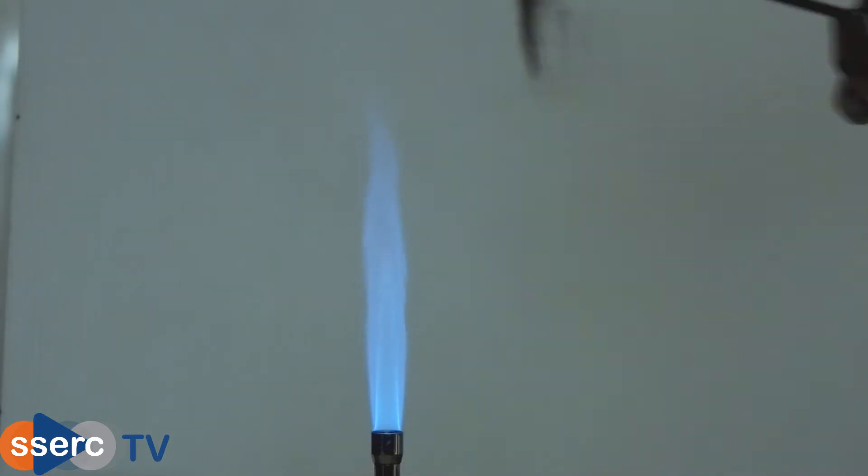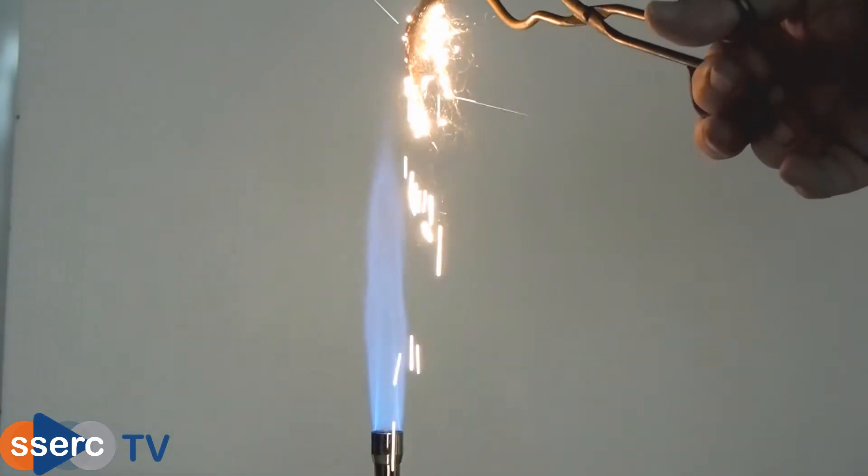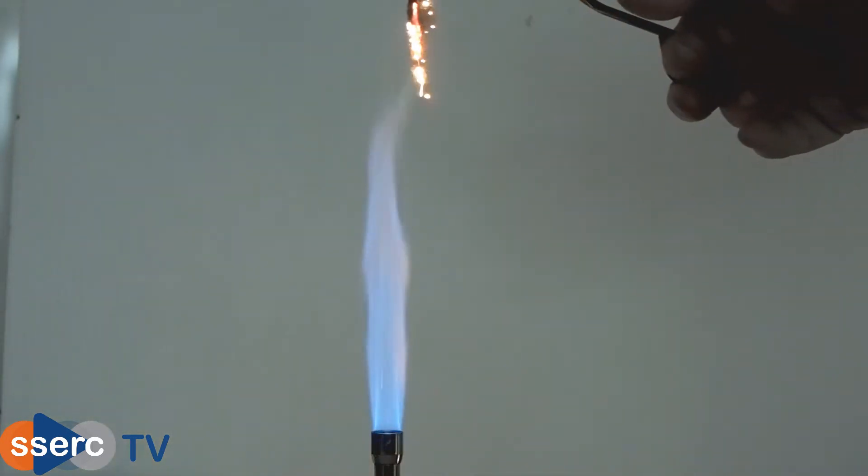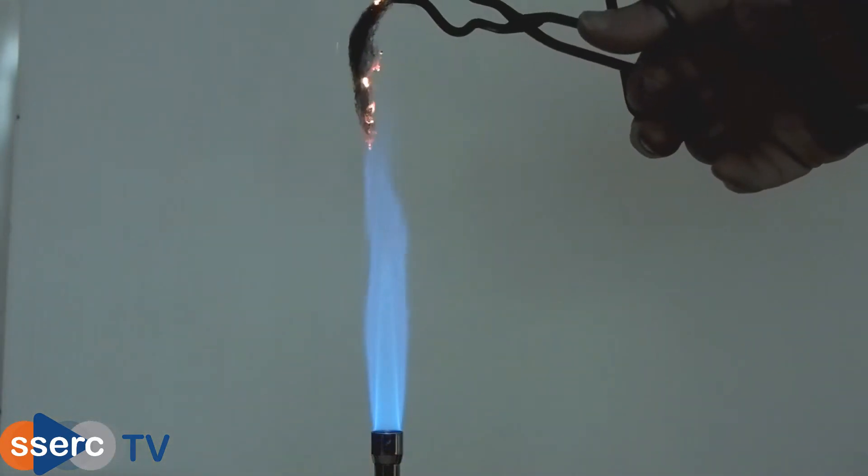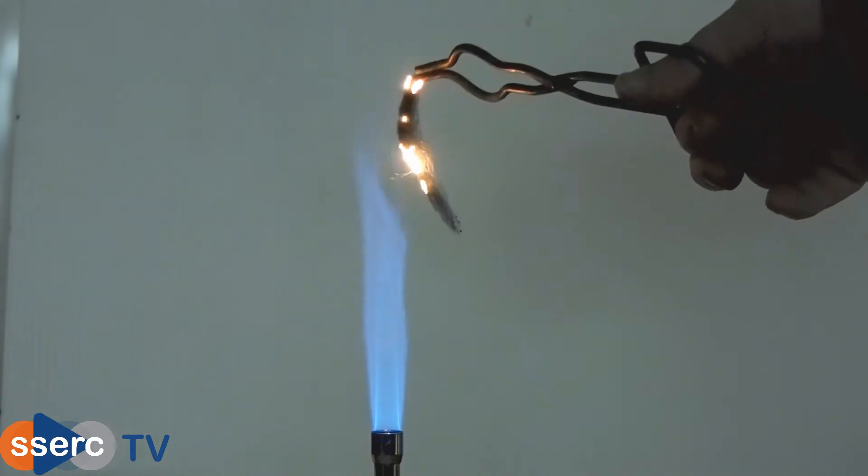If instead you take iron wool, the thin fibers allow a lot more oxygen to contact the metal and this time it actually does burn. You can see a cascade of sparks as it reacts with the oxygen.